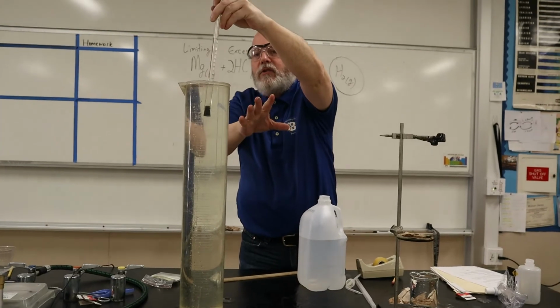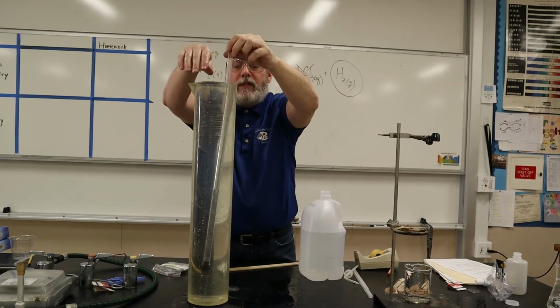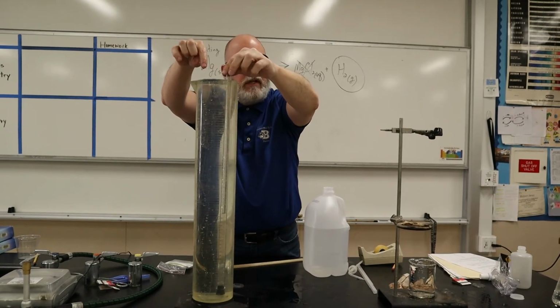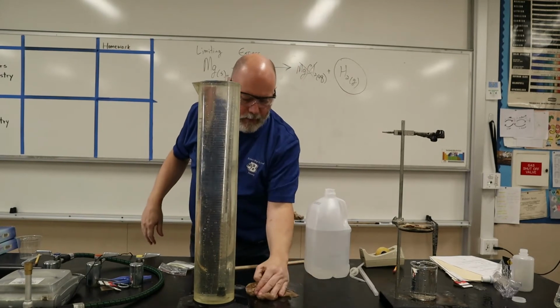Okay, I can take my finger off. So no air got in, that's good. I didn't see any air. Now I'm gonna let it sit for a second. I'm gonna explain something. I'm gonna explain why we put it in here. Okay? Let me clean up a little bit. It's just water.